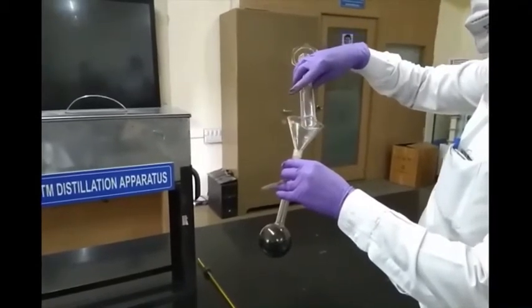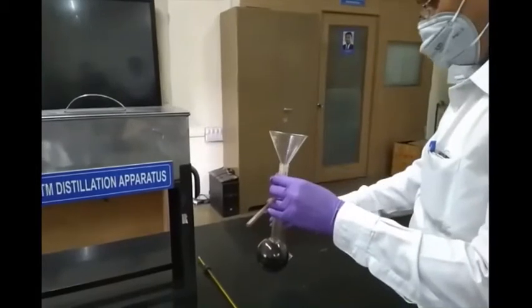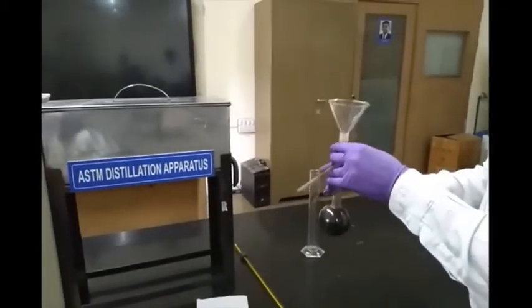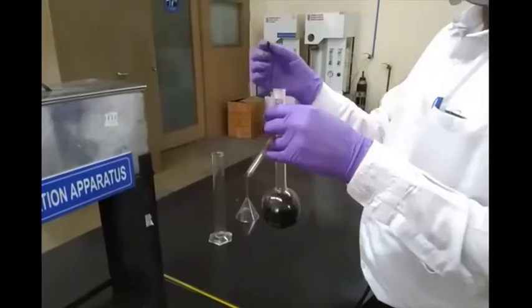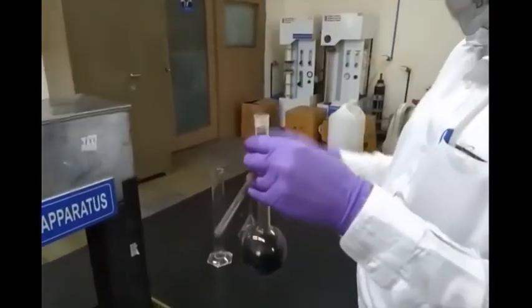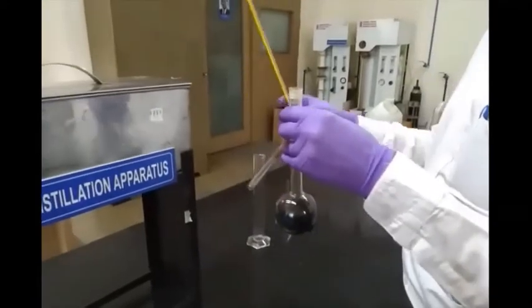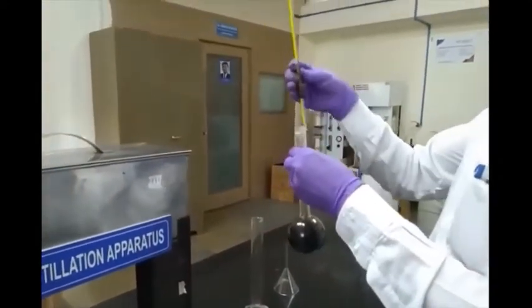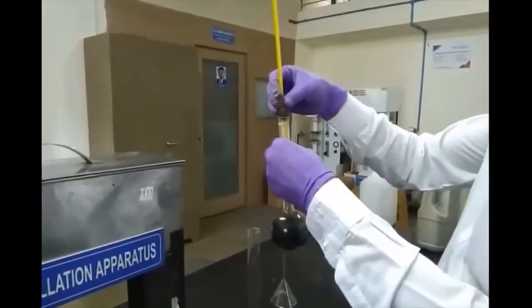First, we take a 100 ml sample in a round bottom flask. Then we put in some porcelain pieces. These liquids are highly volatile, so to avoid bumping, we put in the porcelain pieces.